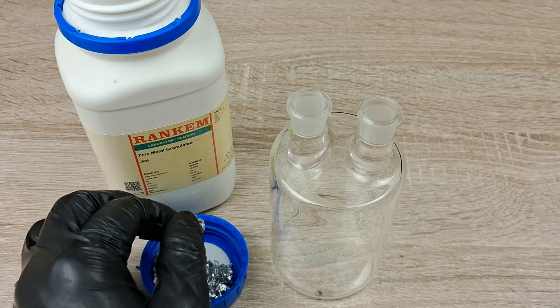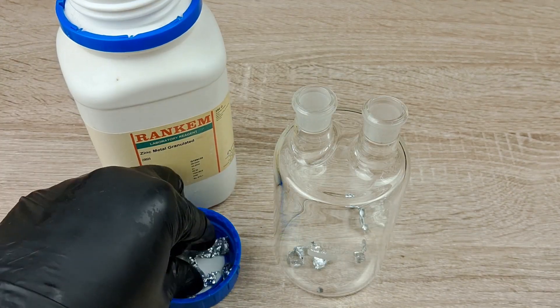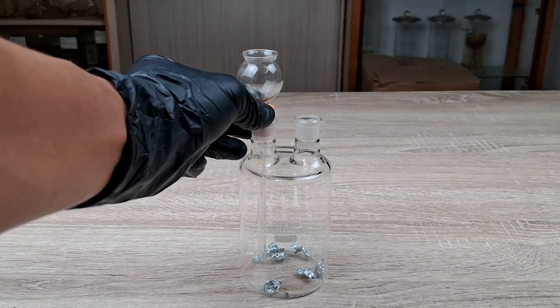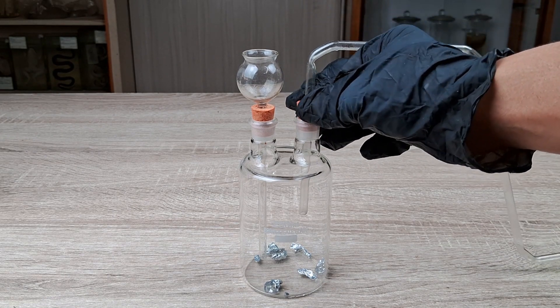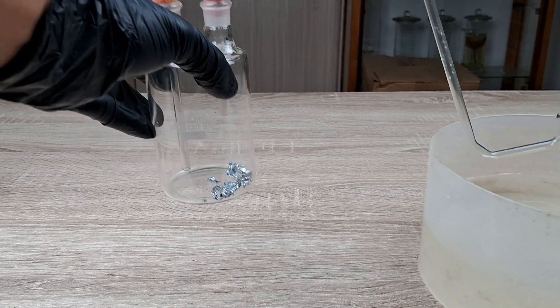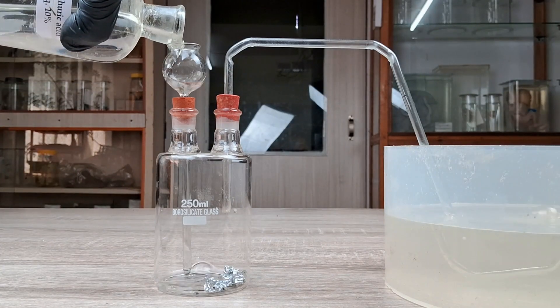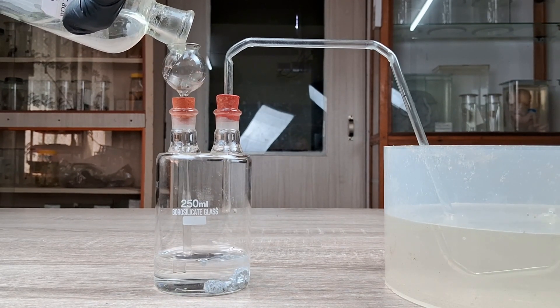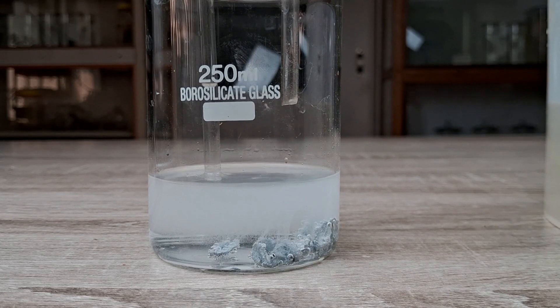Procedure: first, introduce a few pieces of zinc granules into the Woulff bottle. Next, stopper the two holes of the bottle with the rubber corks pre-inserted with the thistle funnel and the delivery tube. Immerse the free end of the delivery tube into the water contained in the trough or beaker. Now carefully pour enough of the dilute sulfuric acid into the thistle funnel until the lower end of the funnel is submerged in the acid.